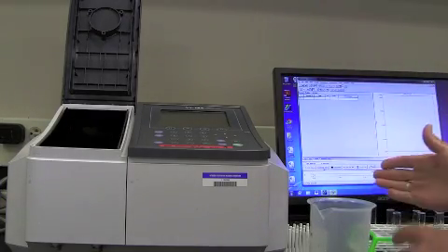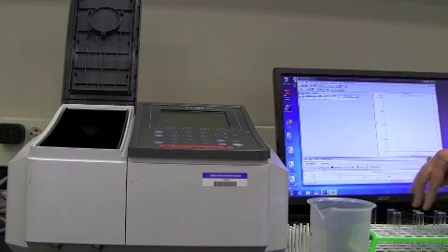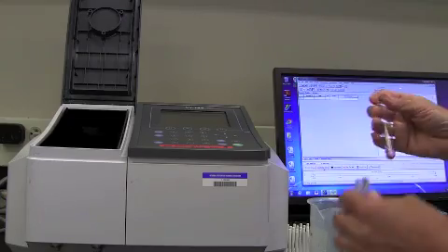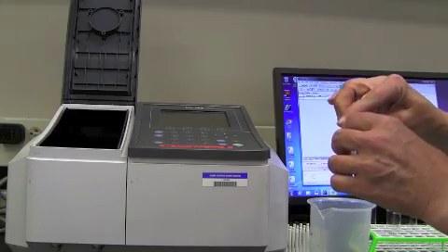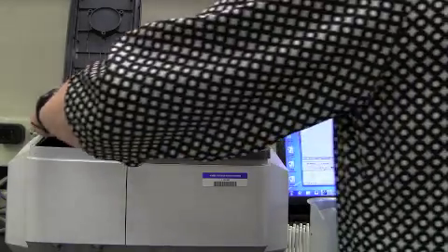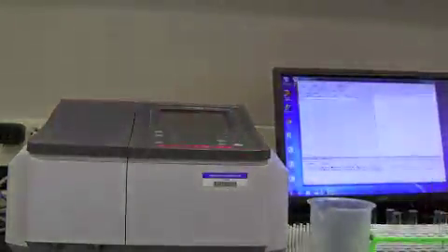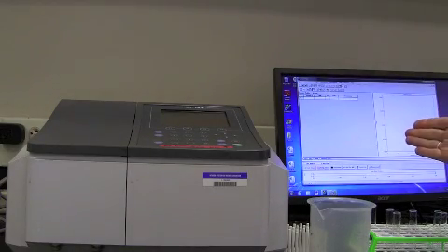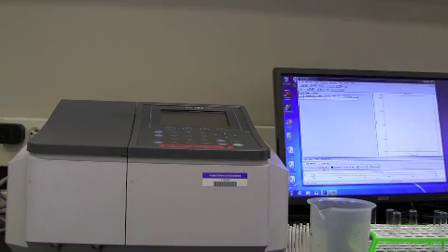and then we continue reading. I'm going to read the 220s and the 230s. Now, I don't actually need to rinse out the cuvette when I'm doing the standard, as long as I start at the least concentrated and go to the most concentrated, I can just kind of get any drops out of the tube and just pour in the next one. So here's our 20 mg% sample, and this should have a higher absorbance than the previous one, and it does indeed. Its absorbance is 0.401.